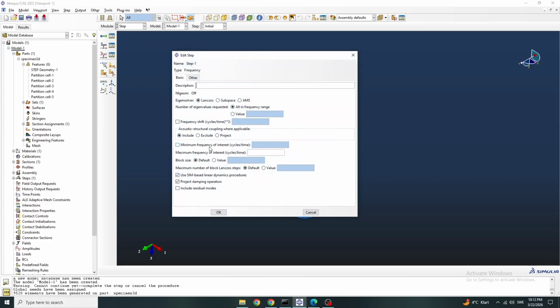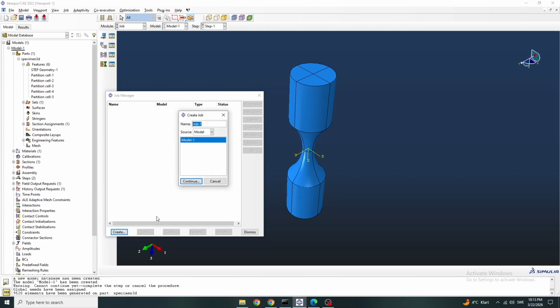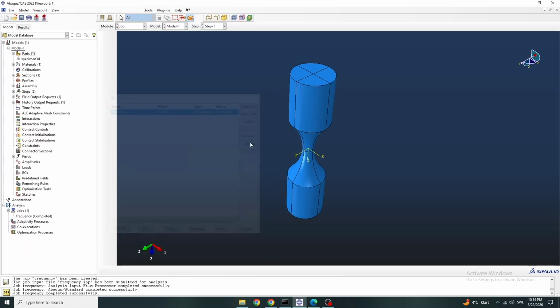You can do a range, to find the natural frequencies between a minimum and maximum frequency of interest, but for my case I'm going to go for 21 eigenvalues, and create a job, frequency, and submit it.